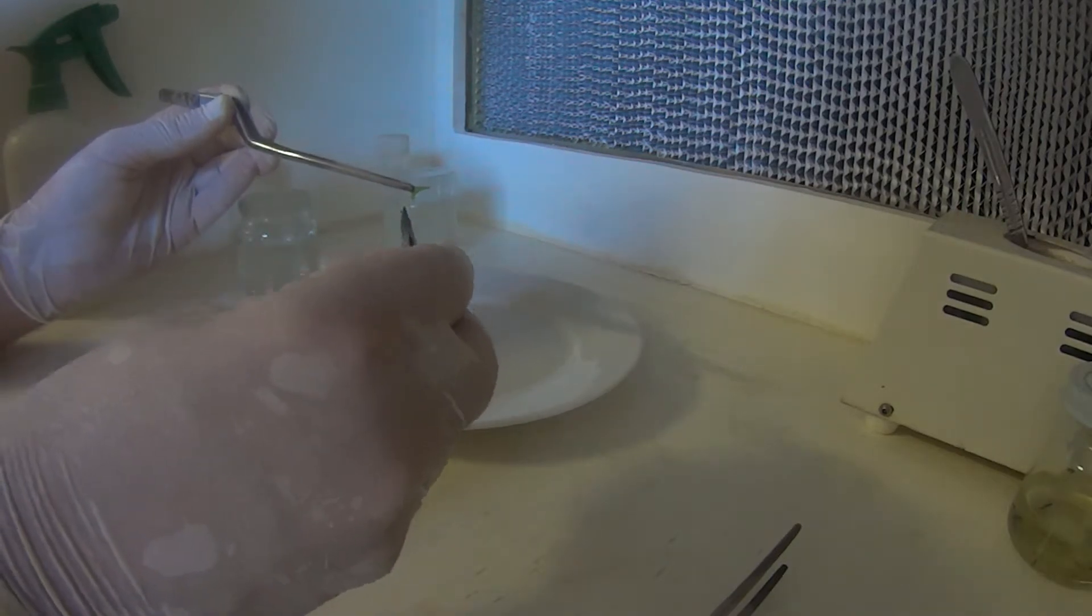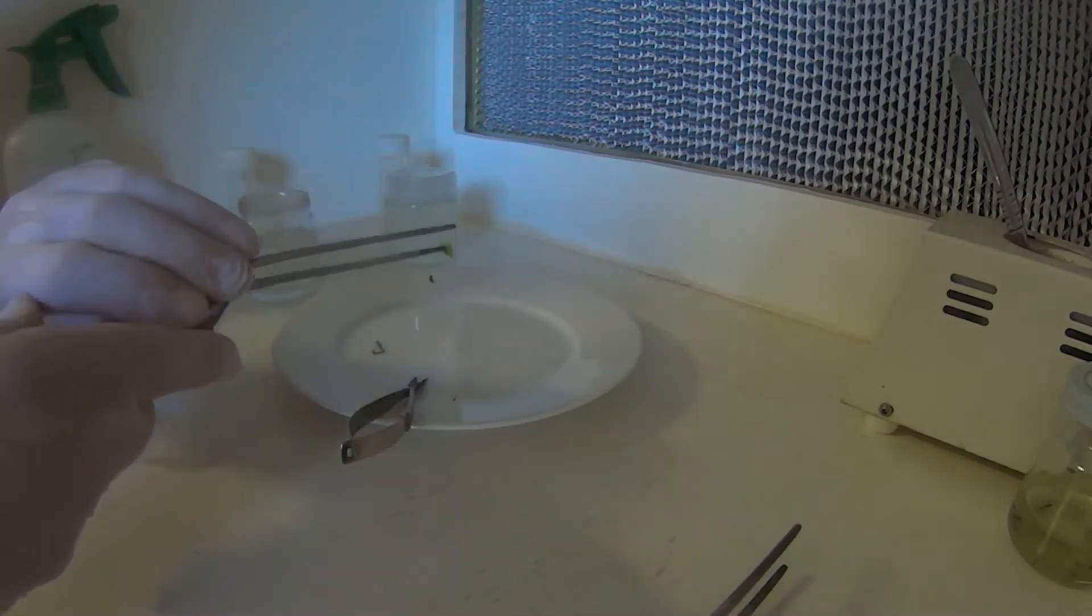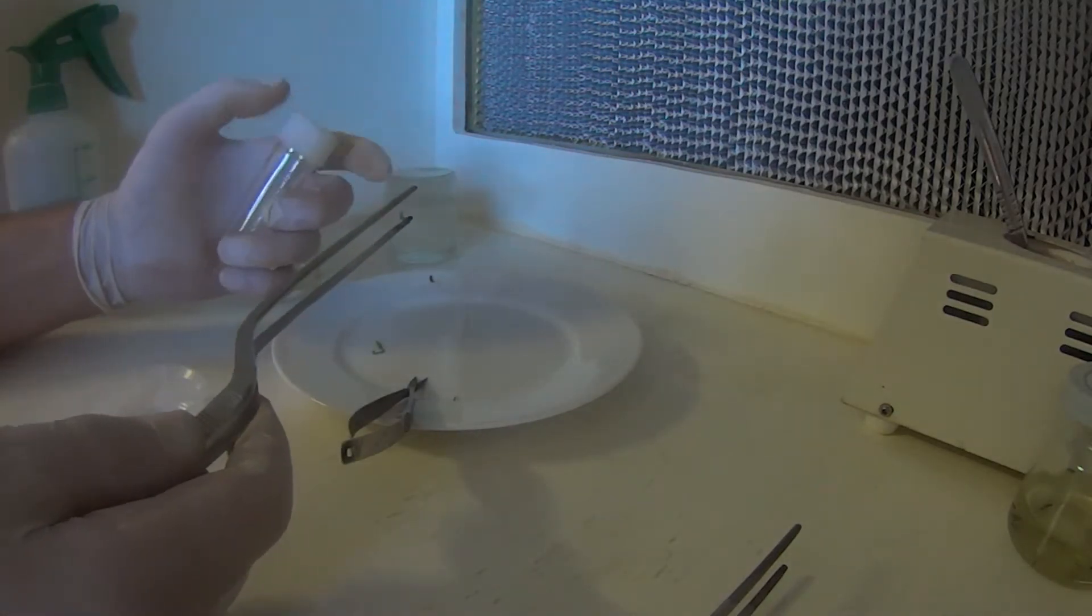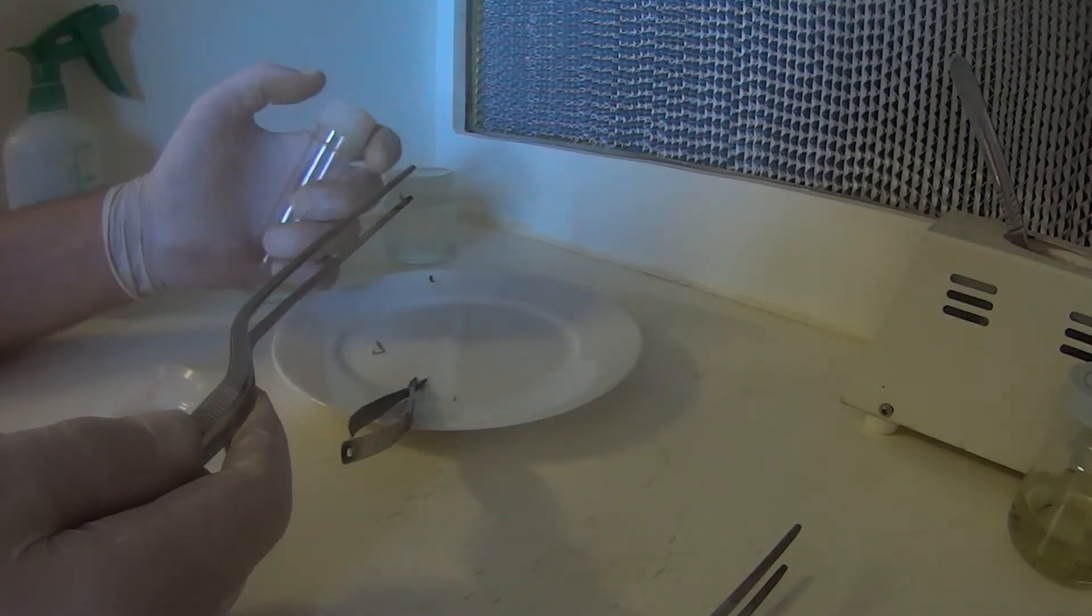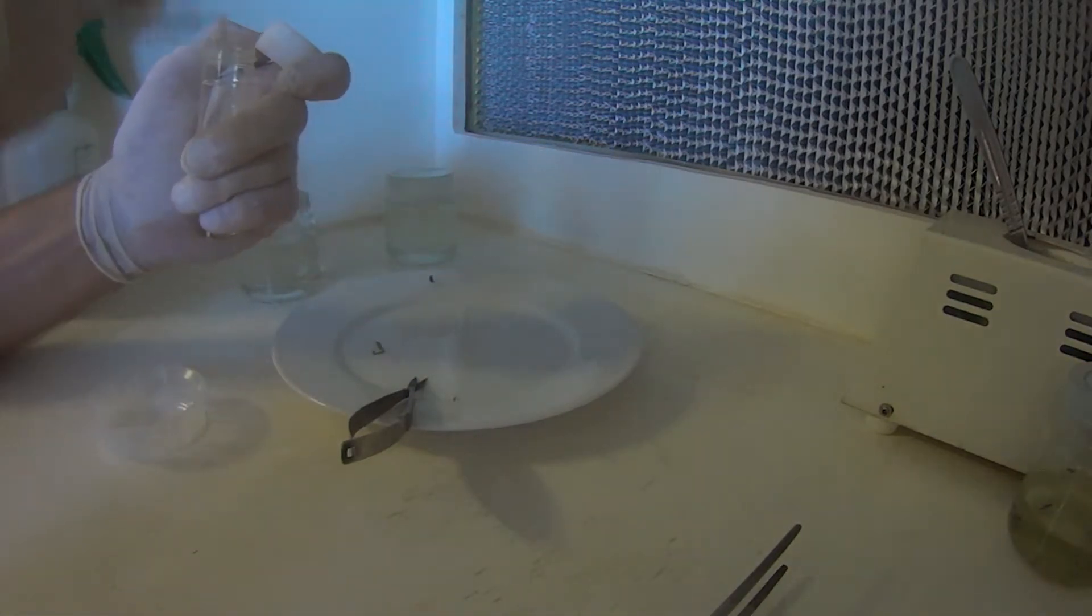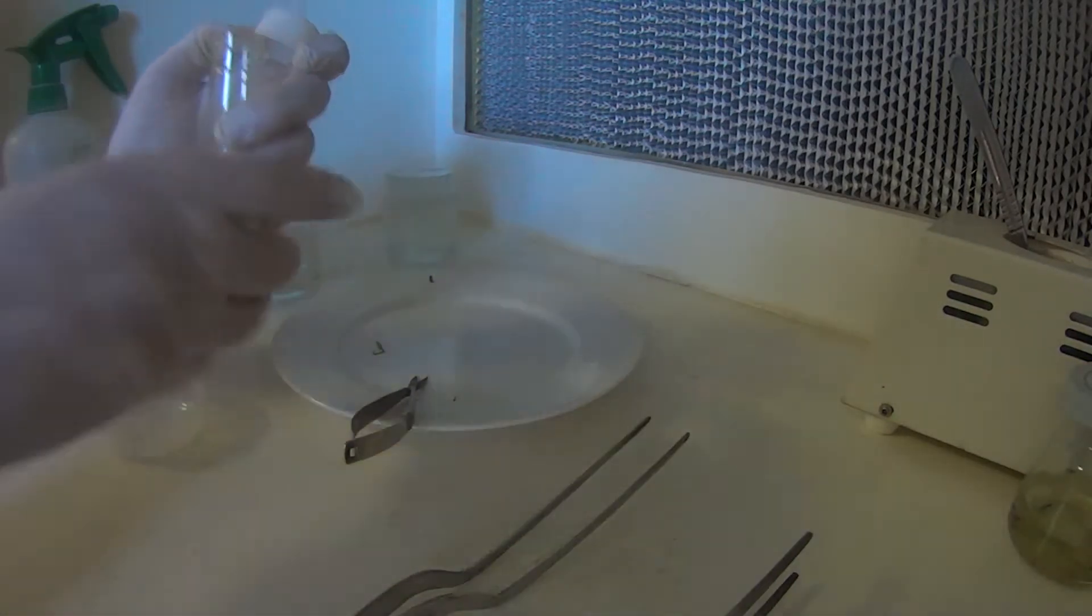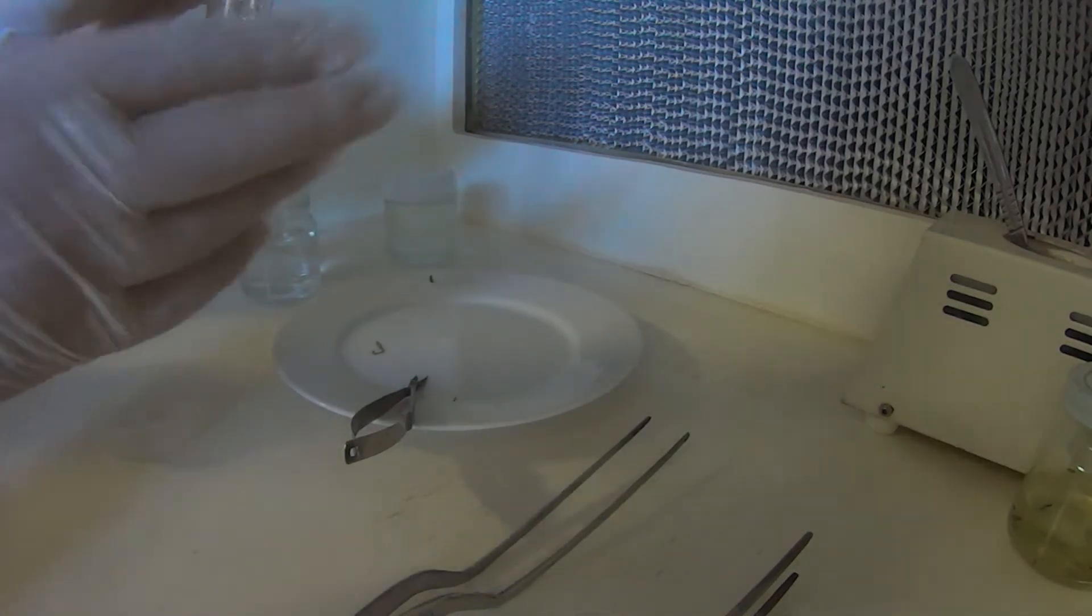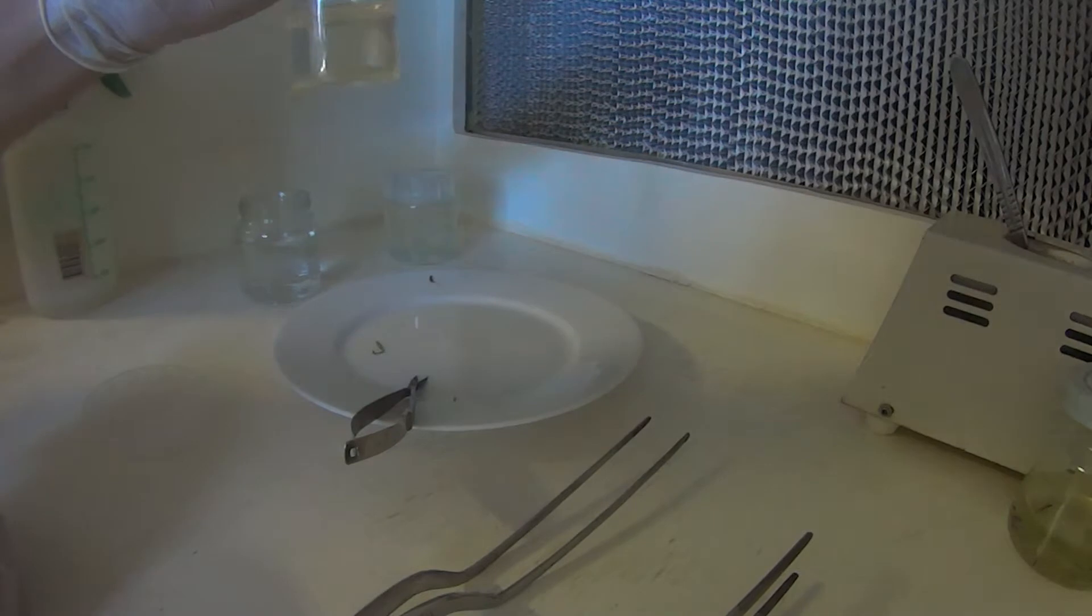It was going a little bit clear where the bleach had got into the actual leaf itself. Just pop this one in too. Lay it down flat. And there we go.